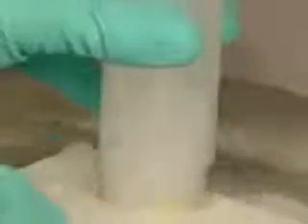When the halogens react with hydrogen, the hydrogen halides are produced: HF, HCl, HBr and HI. In each compound, the halogen has a valency of 1. All four compounds are gases. They're also very soluble in water. Here's water swallowing a jar of hydrogen chloride.